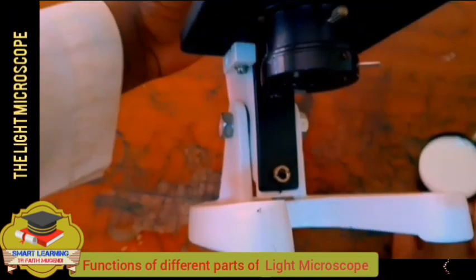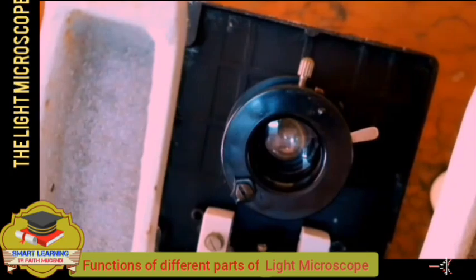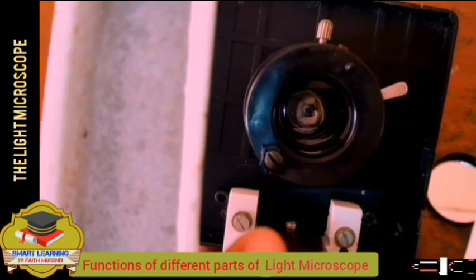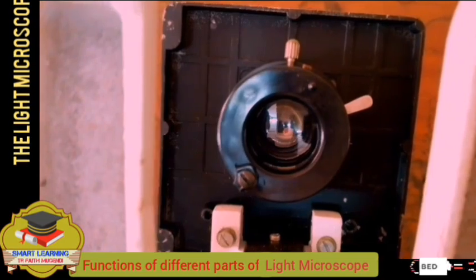That is when we can see the inside. You can see some lenses there. Those lenses, we are calling them the condenser.